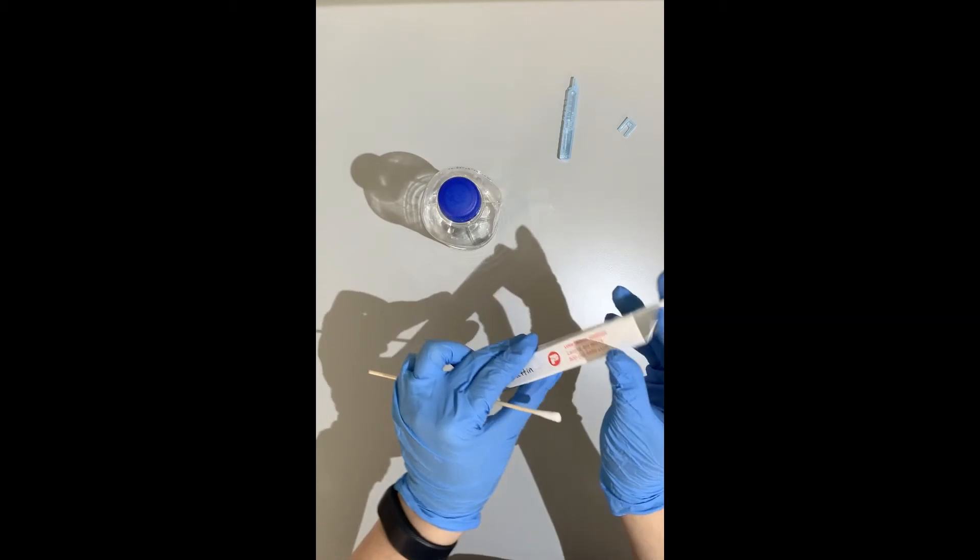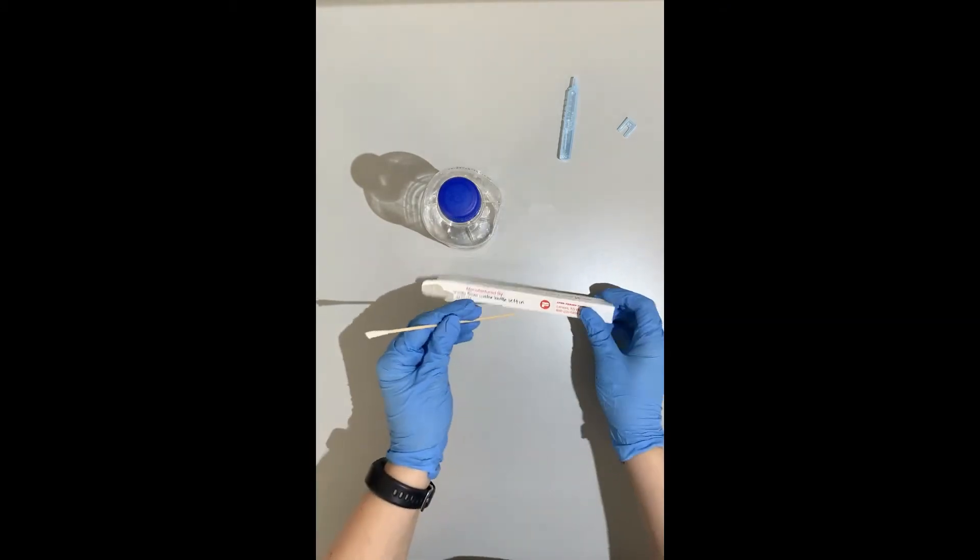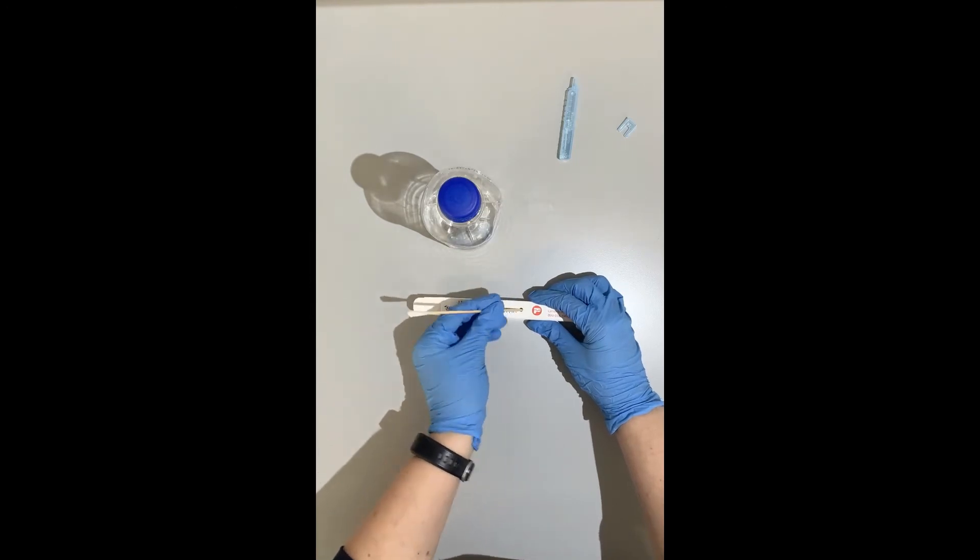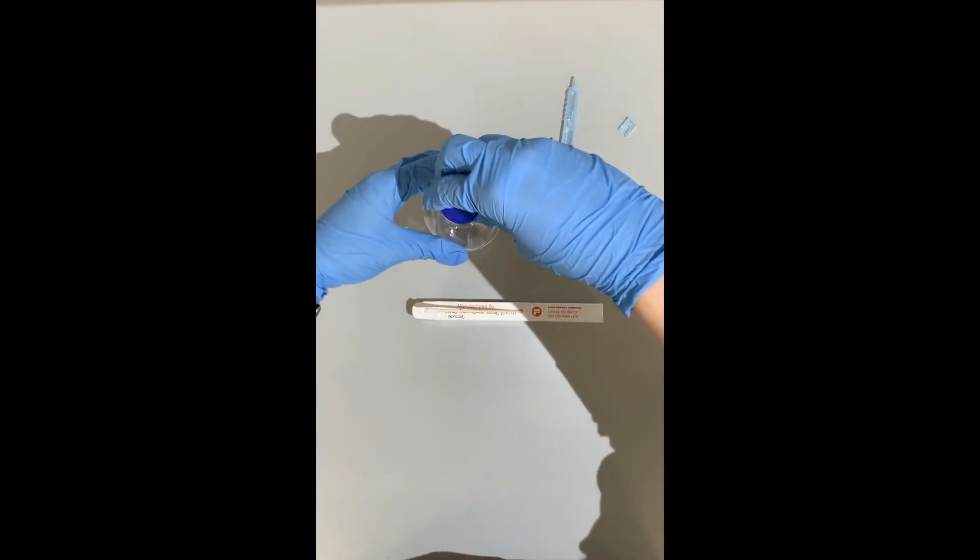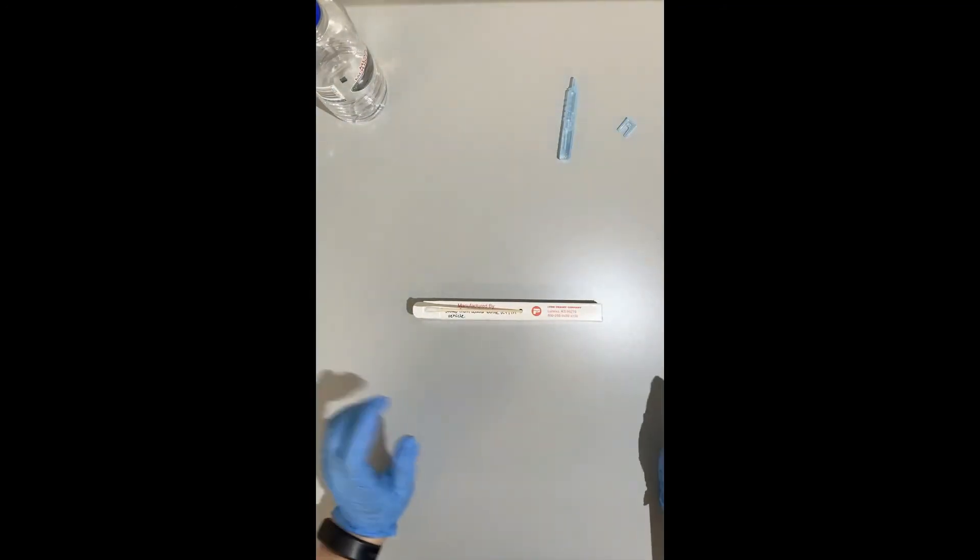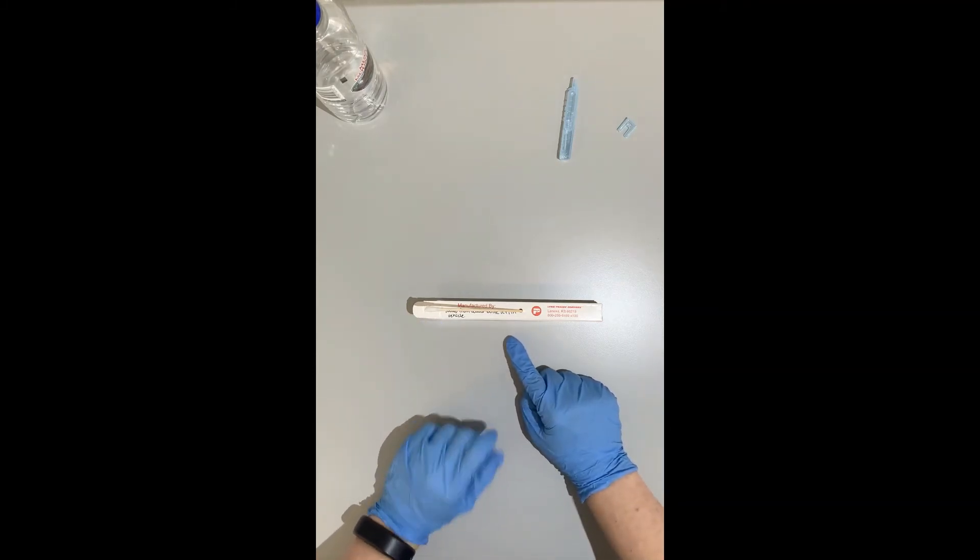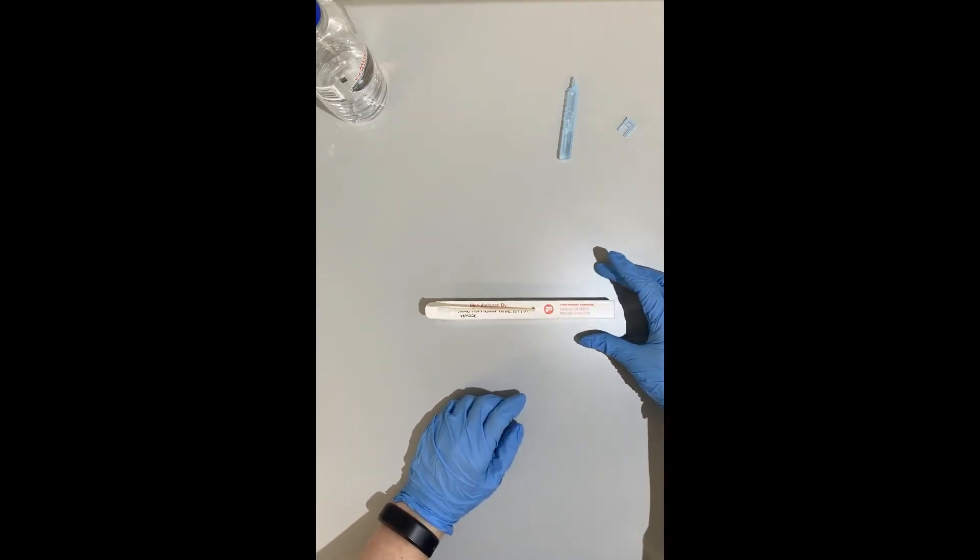I'll open up the swab carton and before I can put my swab directly into the box, I want to let it dry. They have these nice little holes that they can sit in and air dry and you want to let it dry for 10 to 15 minutes at minimum so that there's no liquid on the sides, no wet liquid on the side of your swab that could get onto the swab carton and contaminate or destroy your evidence and lead to mold.